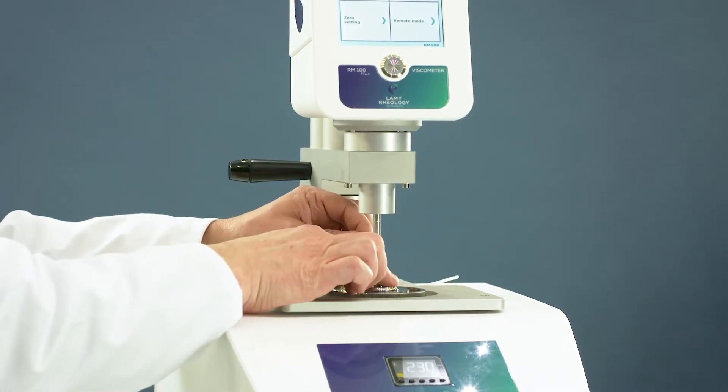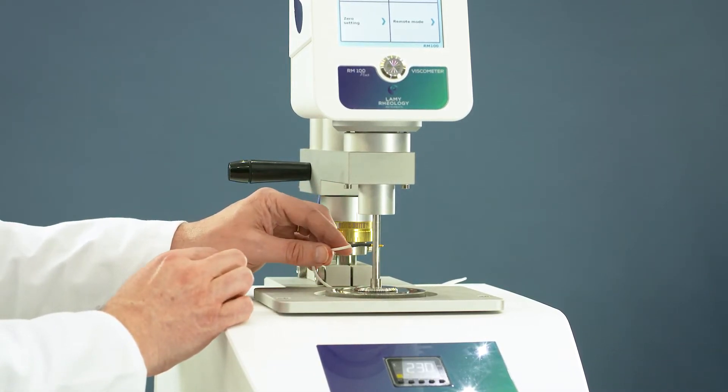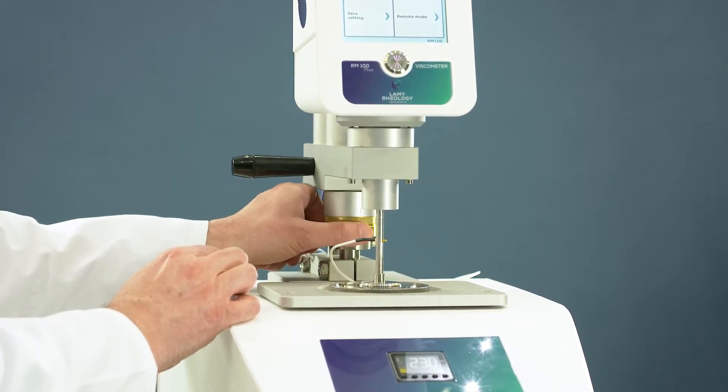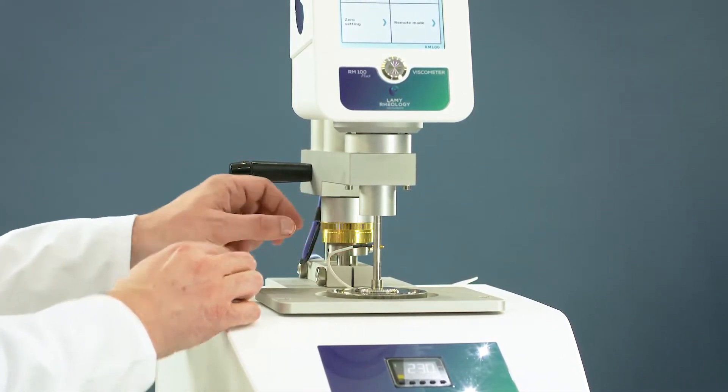Plug the white cable inside the spindle's shaft. Turn the brace ring clockwise until the beeping sound. Measuring position is reached.